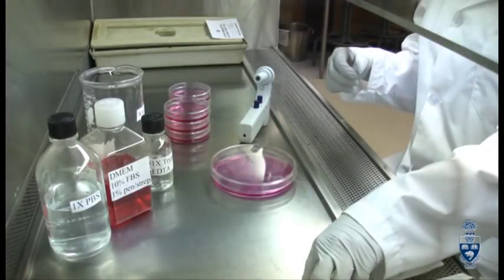Now we are ready to passage our MCF7 cells for our experiment. How we do this is we will remove the existing media, rinse the cells with PBS, and then place trypsin on the cells. The trypsin will digest the external proteins of the cells, allowing them to lift up off the bottom of the dish. Then we will dilute the cells in new media and place the newly diluted cells into new plates that contain new media so that the cells can now grow in different sized plates for our experiment.